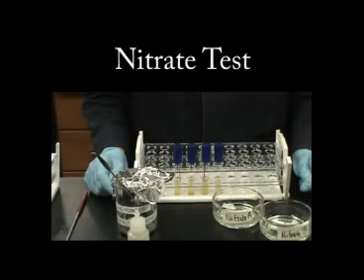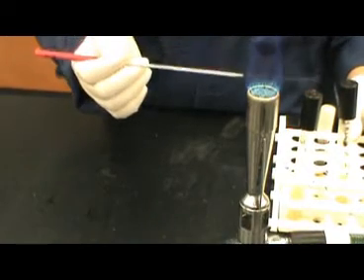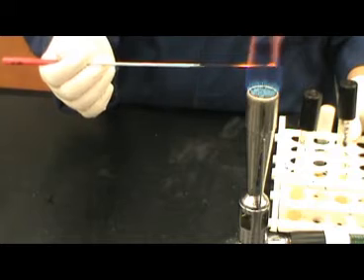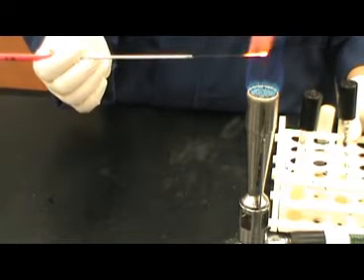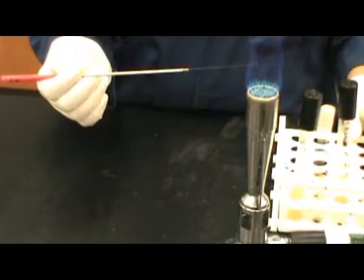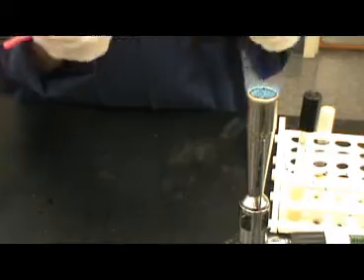The nitrate test, testing for nitrate reduction. The nitrate test is a simple broth inoculation. For this experiment, we will be inoculating 4 different broths. Your instructor may also have you inoculate 1 nitrate broth with some soil.